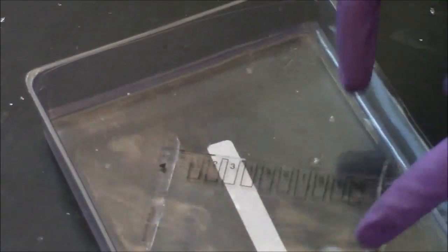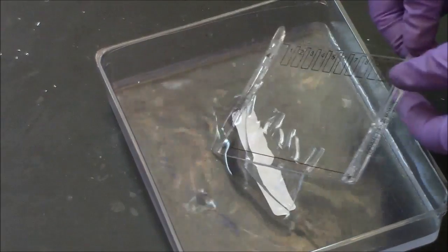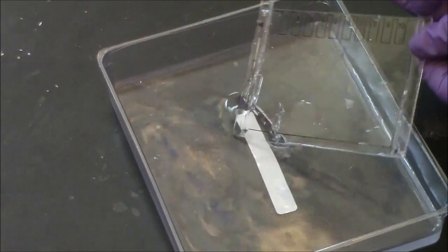Try to pull the plate out from here now. There we go. Like a jellyfish.